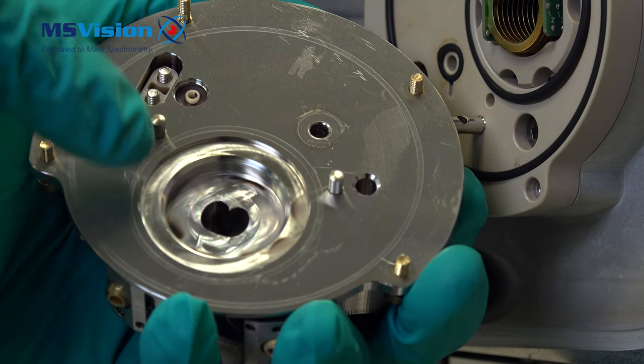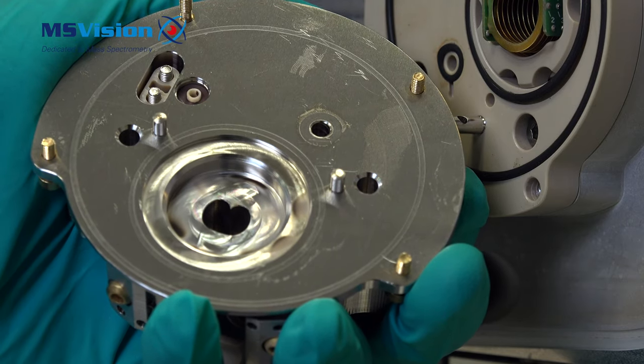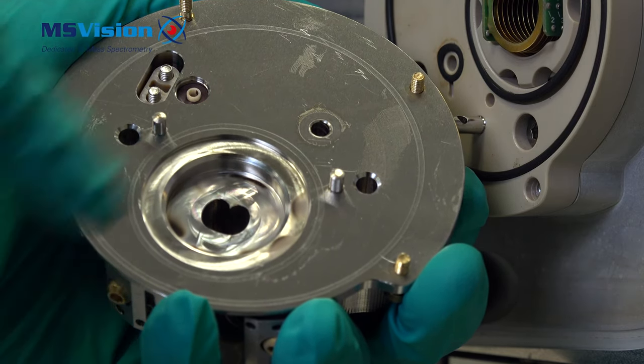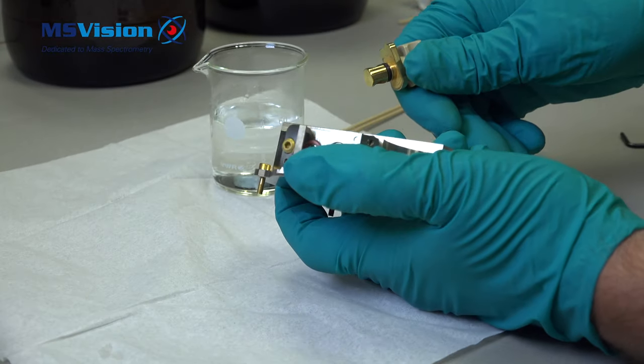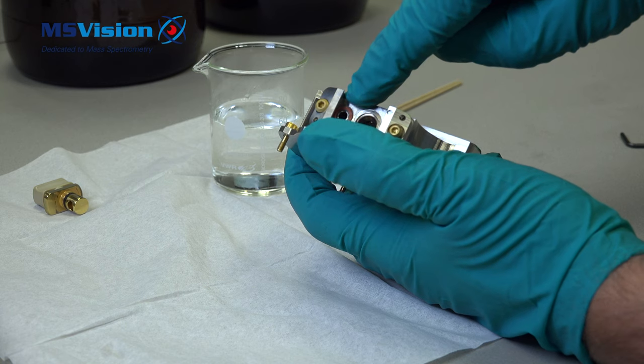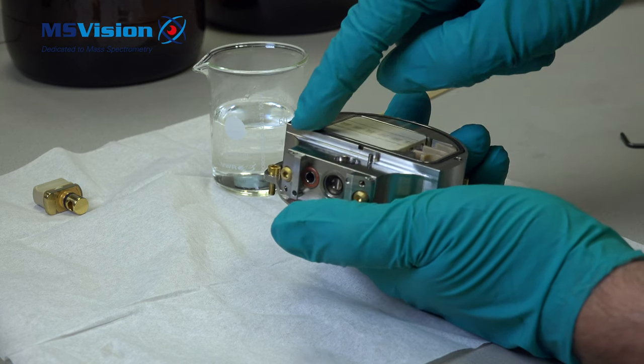Remove the isolation valve held in by an o-ring. Then we can clean the inside. Remove the red teflon o-ring, the heater cover o-ring and the heater.